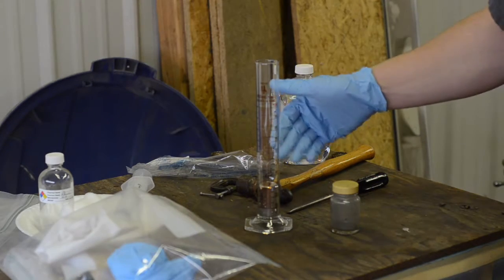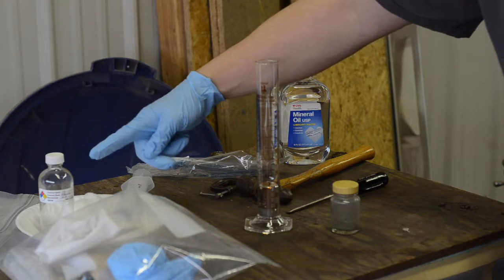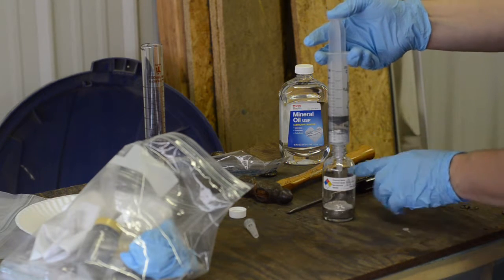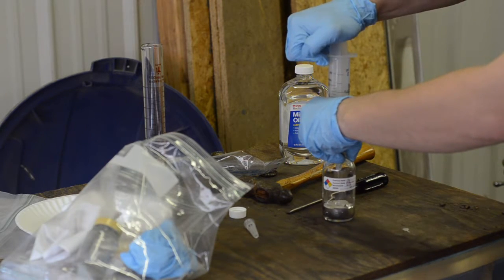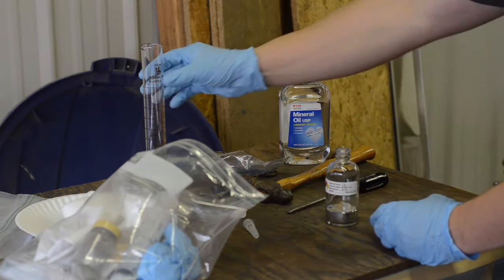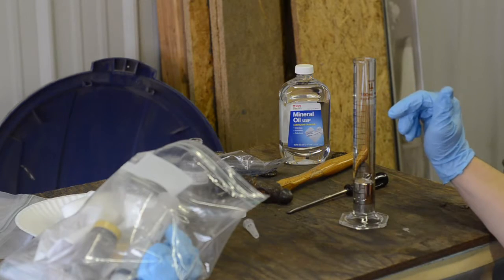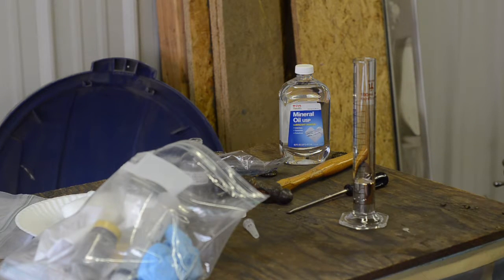All right, with that step successful, I'm now going to place the mercury back into the mechanical filter for one more pass, and we will put it into our final vessel. So now we have our fairly clean mercury in a more appropriate storage container. Now that it is all filtered, I would like to get a measurement of it since I'm already going to have to clean this. So it looks like we have 28.5 milliliters of mercury.